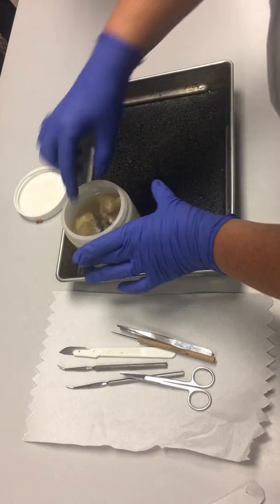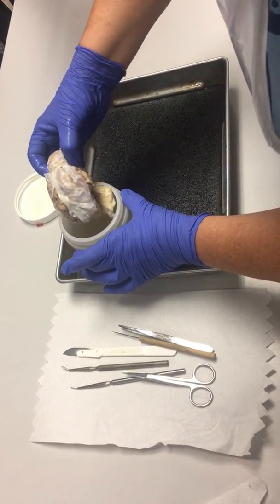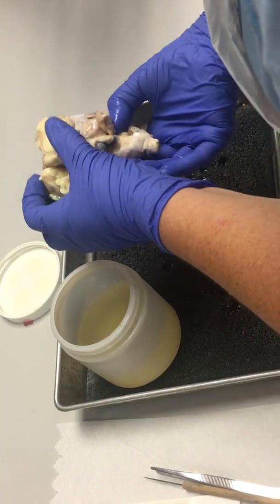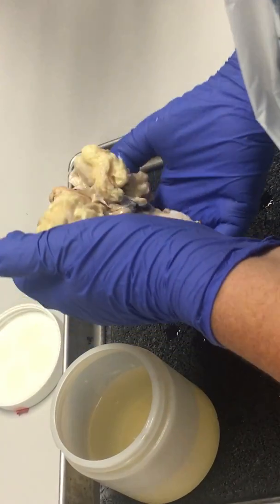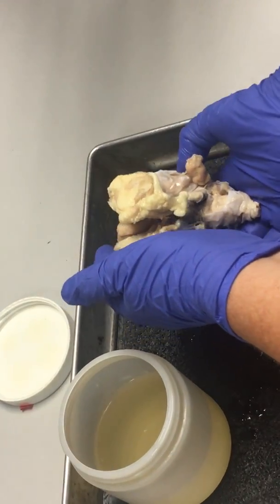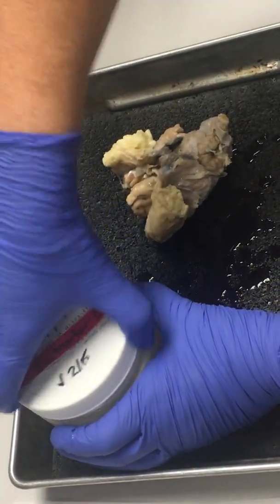Are you ready? This is a sheep brain, and it is sent to us with all of the dura mater attached. You notice it's also got a bunch of fat on it, which is frankly kind of cool. That fat connects to the eyeball and cushions the eyeball. Your eyes actually have a lot of fat cushioning the back of them.